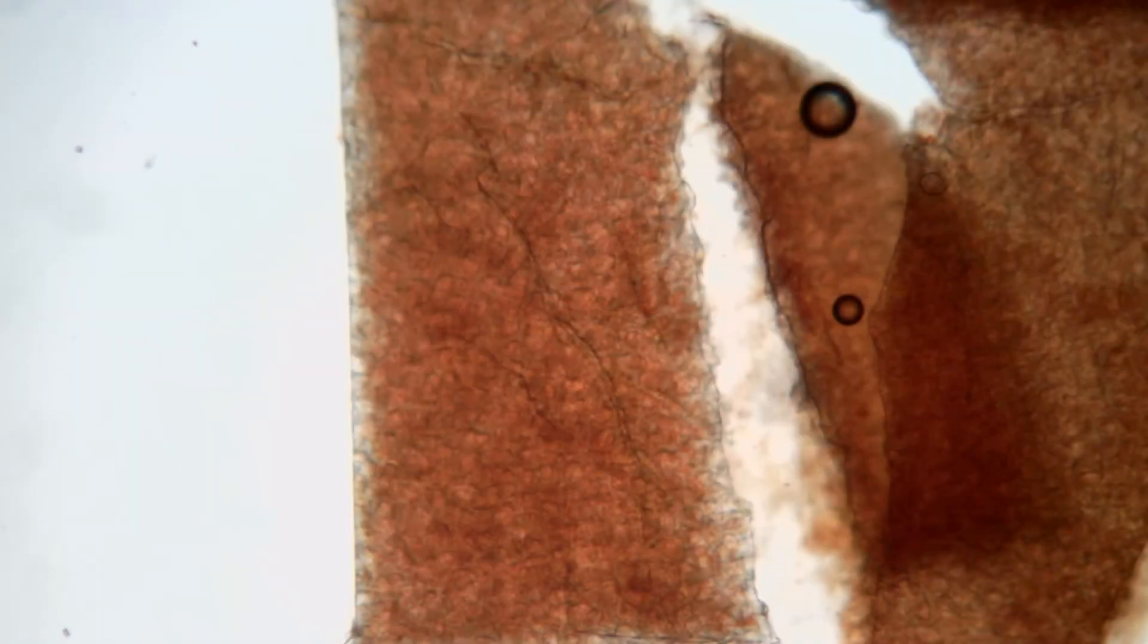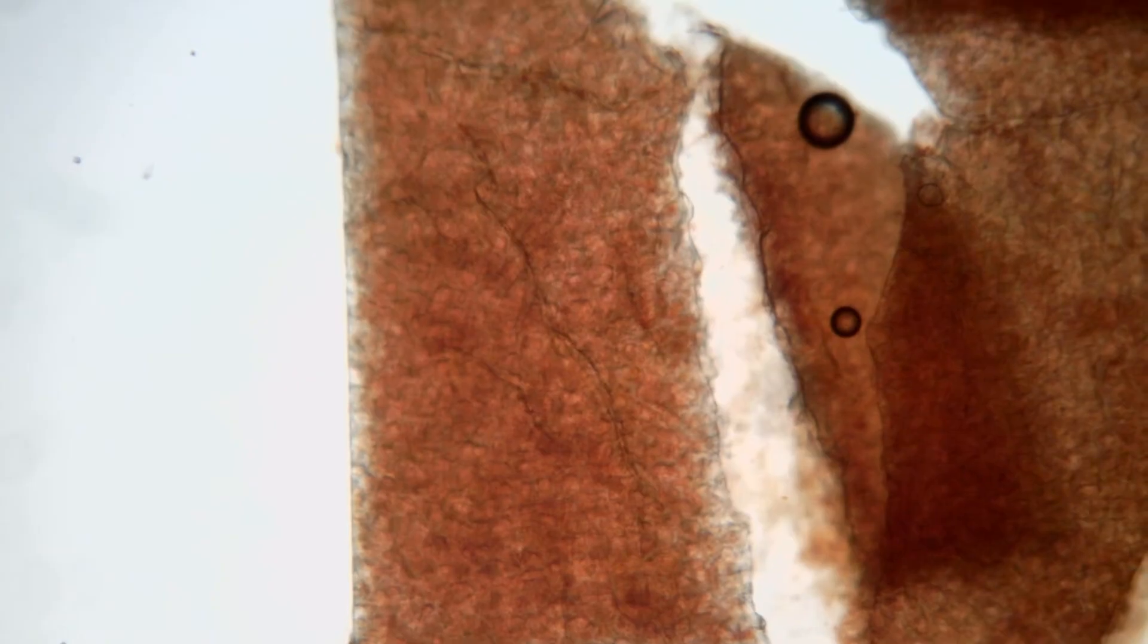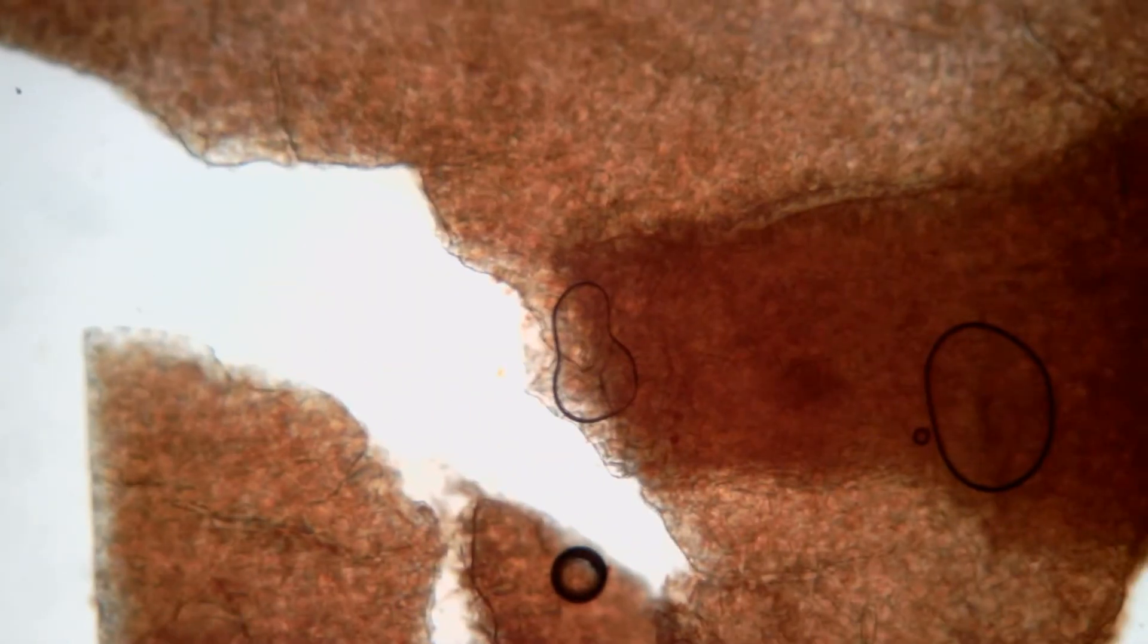Scan your slide under the four times objective. There should not be any large pockets of air trapped in your preparation, and your peel should not be too thick.